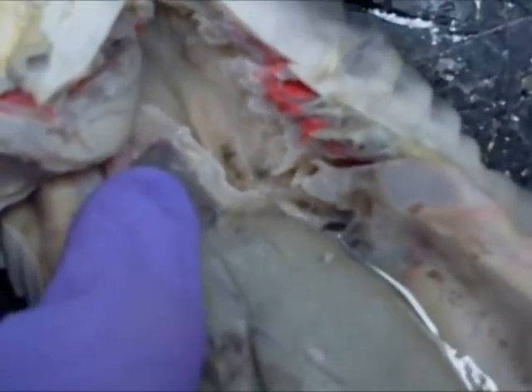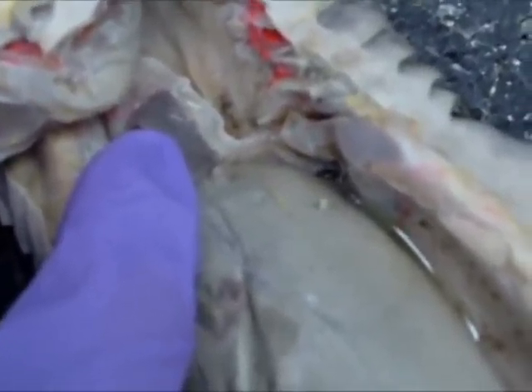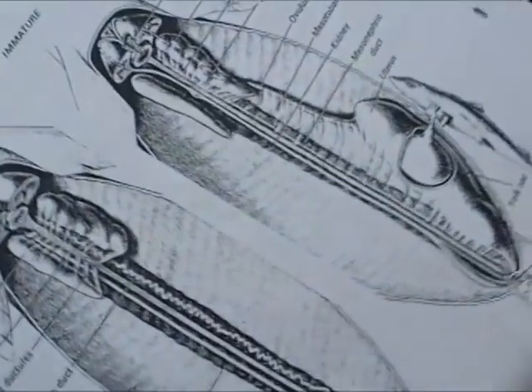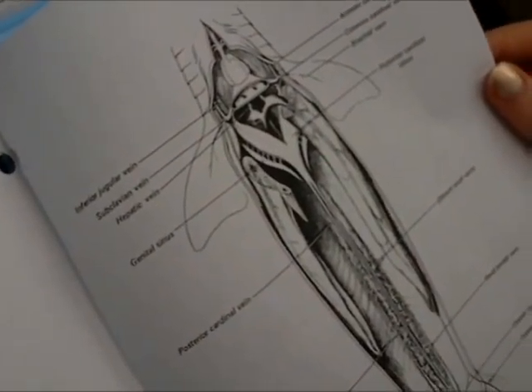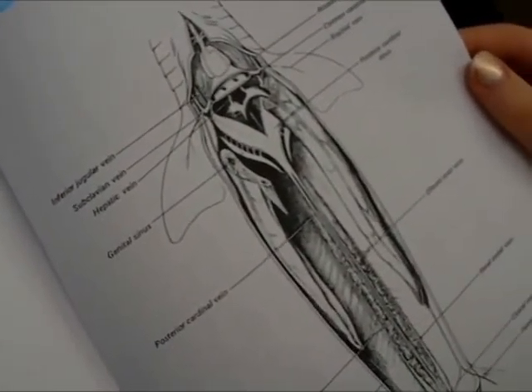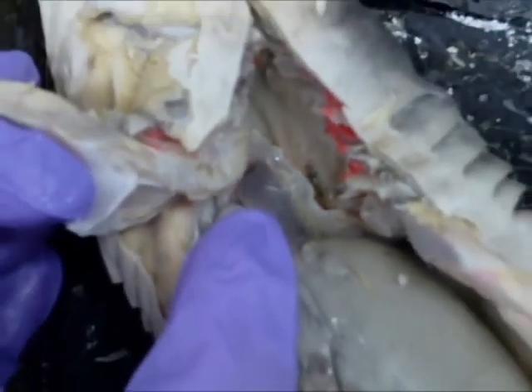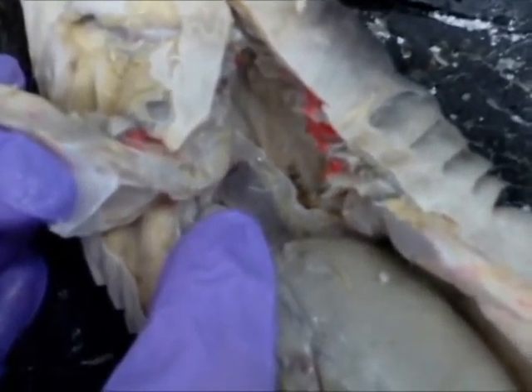What's that dark structure next to the heart? I just noticed it. Right here? I really couldn't tell you. Maybe it's not important.